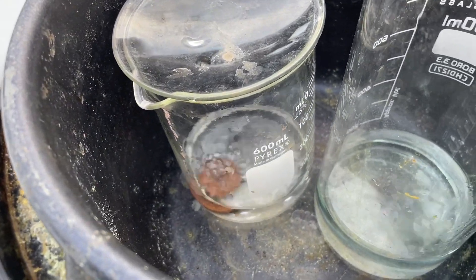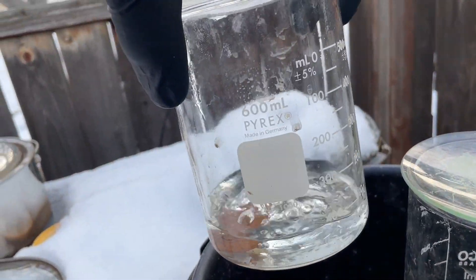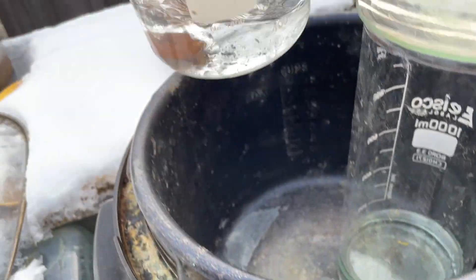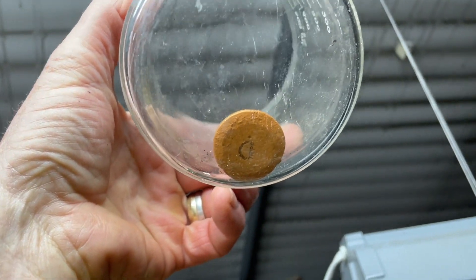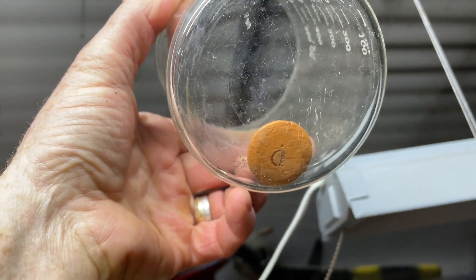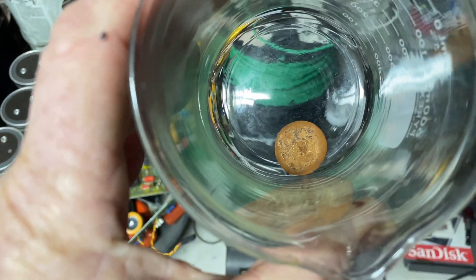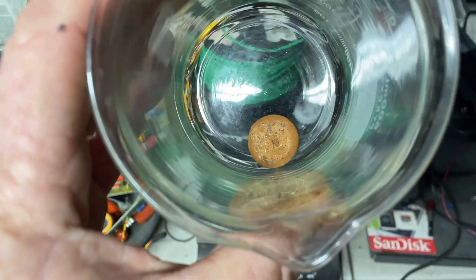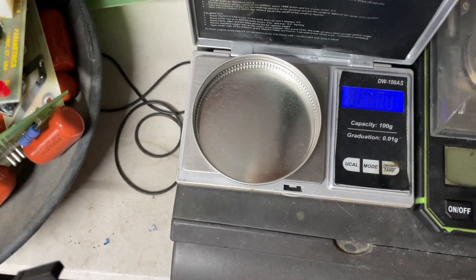That never did make any real fumes — just a tiny, tiny bit. I'm positive there's still active nitric in there, even sitting there boiling away. It had very, very little fumes and the hunk of gold in there is getting light. I dumped it off a few times — just dumped off the silver nitrate — then rinsed it a few times with hot boiling water and boiled it for a while.